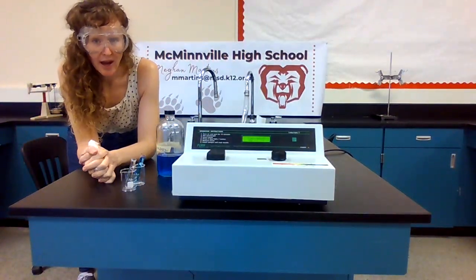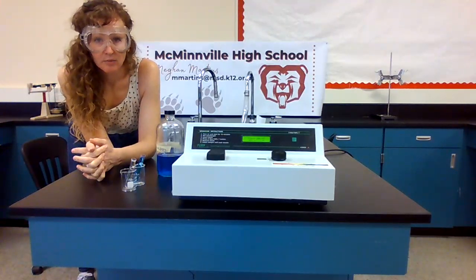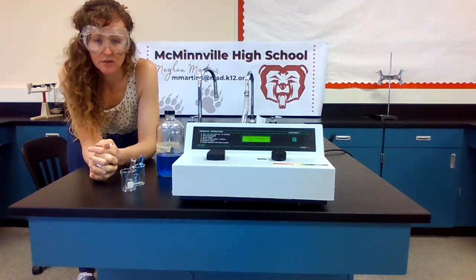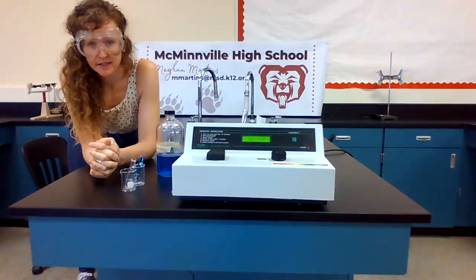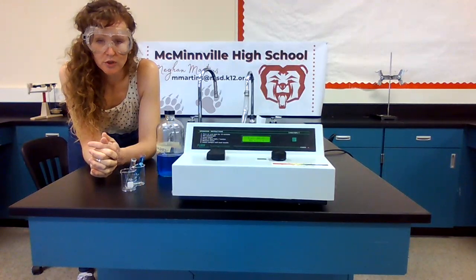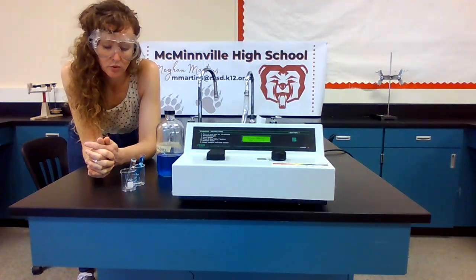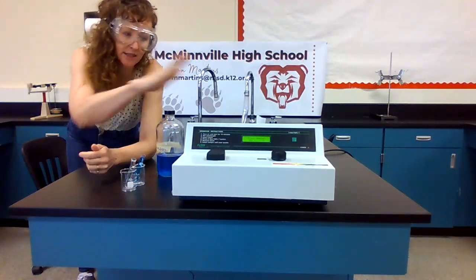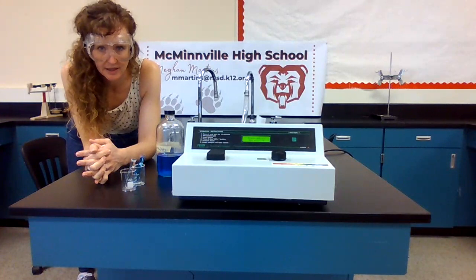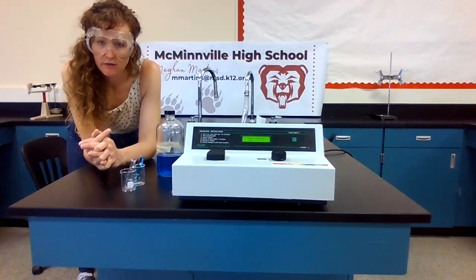Okay, so now you're going to graph that wavelength versus absorbance. Print that out. You want to make a scatter plot. Do not connect the dots. So scatter plot, label your axes, give it a title, and we are going to use that graph to talk about what wavelength we should use to get maximum absorbance within our little guy's range of capabilities. So we're going to choose a wavelength for max absorbance for copper 2 nitrate.